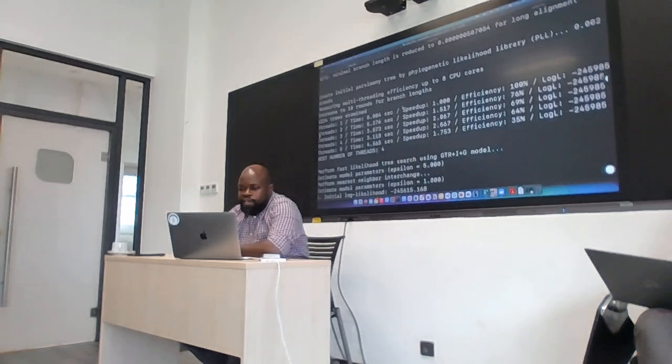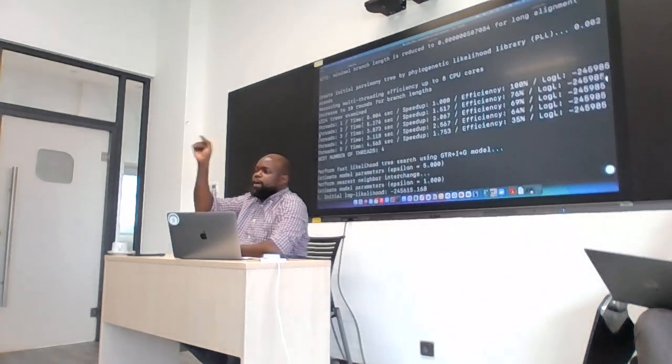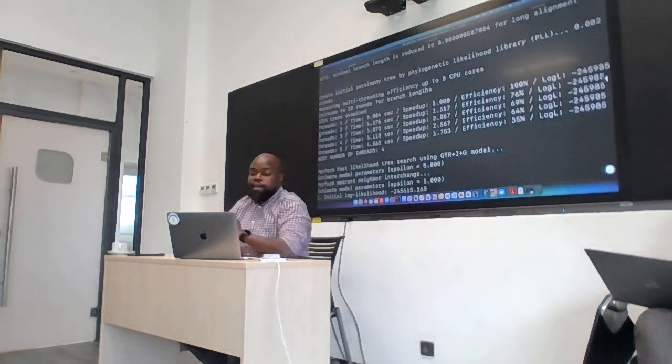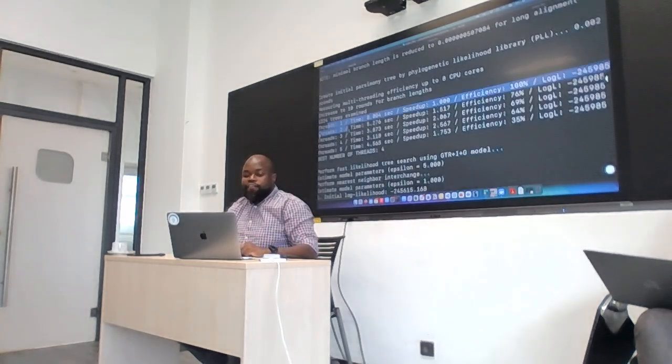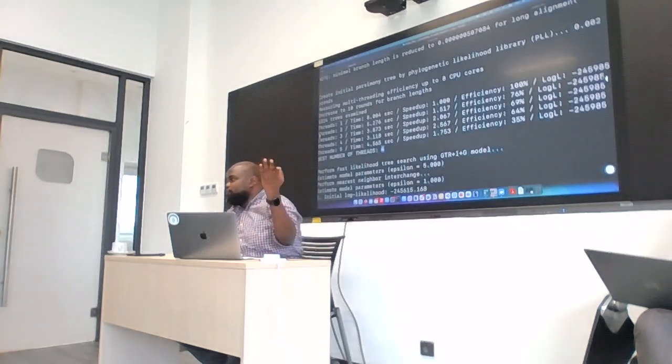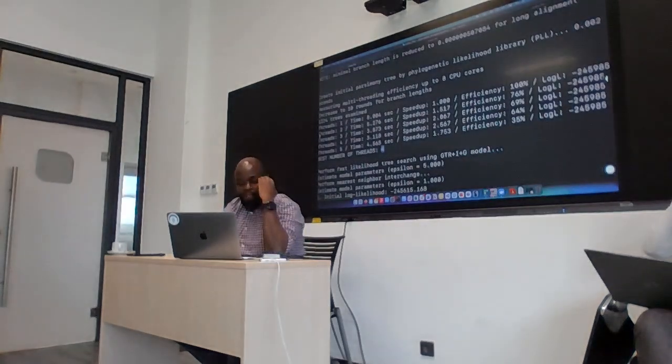Now, we did say, remember the option -T? We said auto. Your computer has a given number of CPUs, right? So here it has determined that the best number of threads to use is 4. Okay, so it's using that.